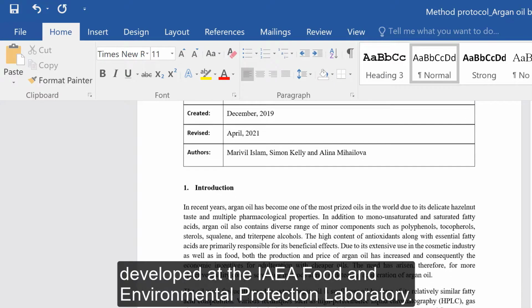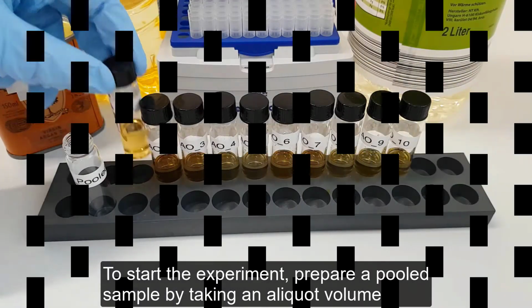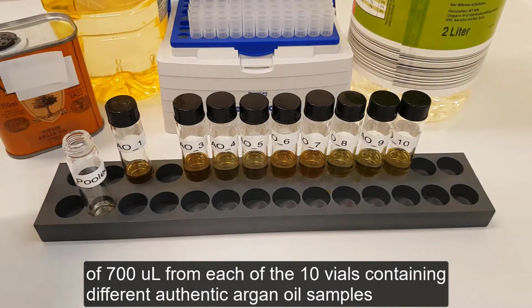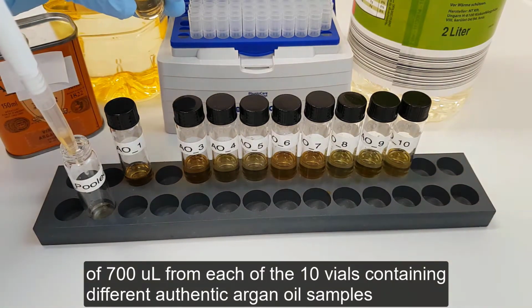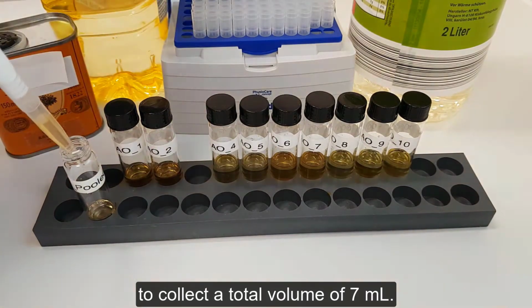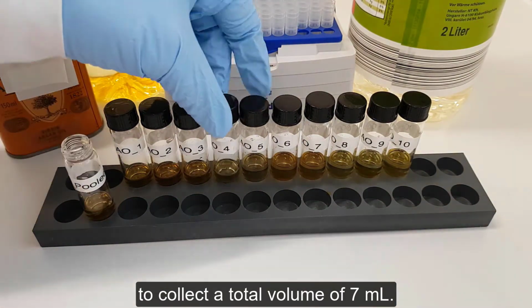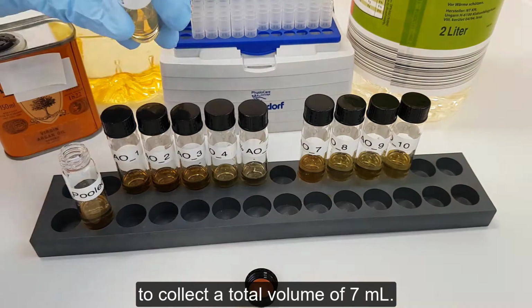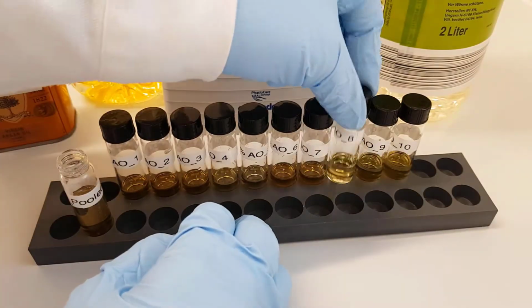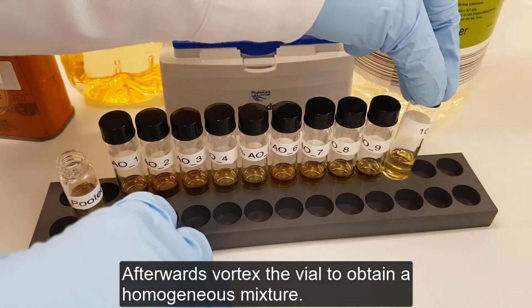To start the experiment, prepare a pooled sample by taking an aliquot volume of 700 microliters from each of the 10 vials containing different authentic argan oil samples to collect a total volume of 7 milliliters. Afterwards, vortex the vial to obtain a homogeneous mixture.